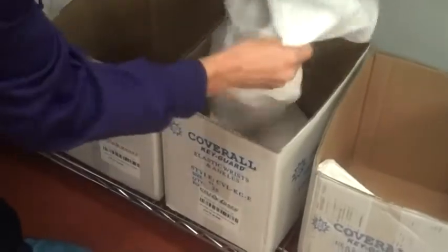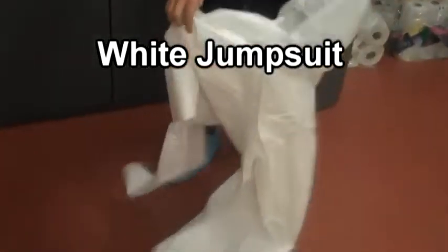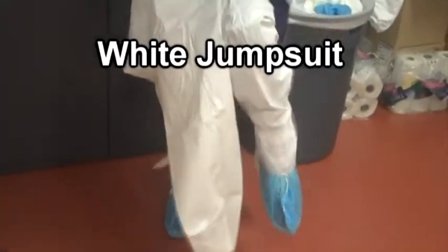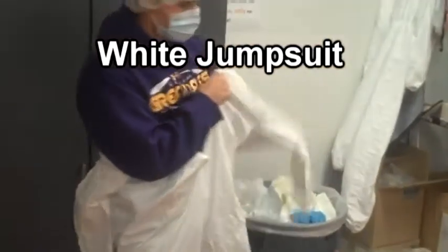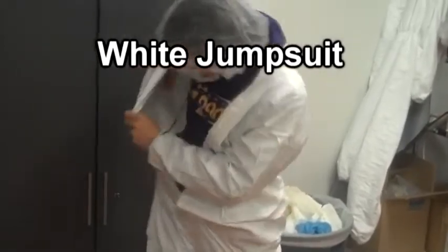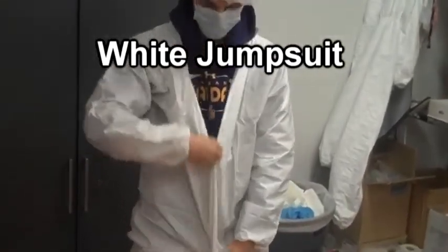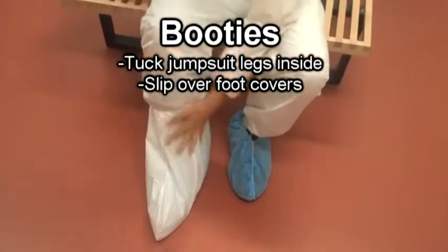Next, it's time to put on the white jumpsuit. Push your legs through the leg holes, and then push your arms through the arm holes. Zip it up. Next, let's put on our white booties. Slip these on over the blue shoe covers and make sure the legs of the white jumpsuit get tucked into the booties.